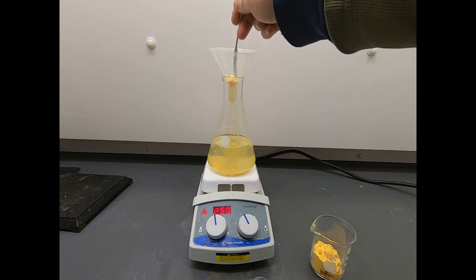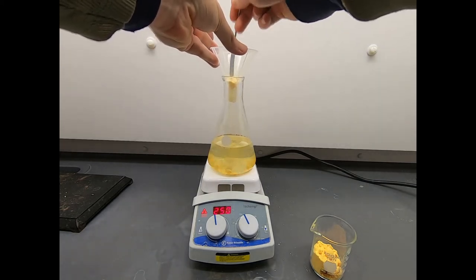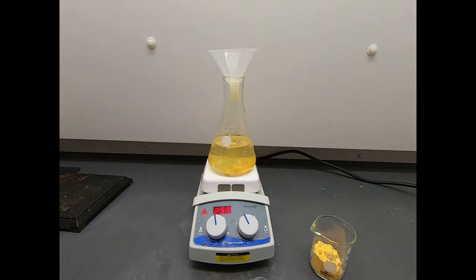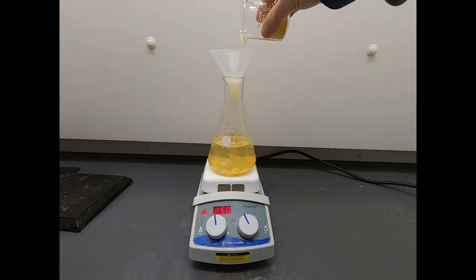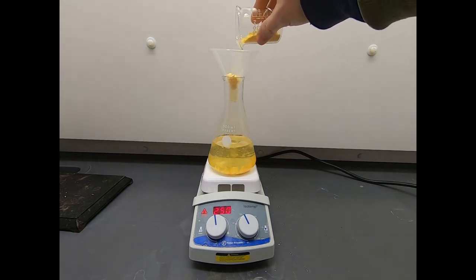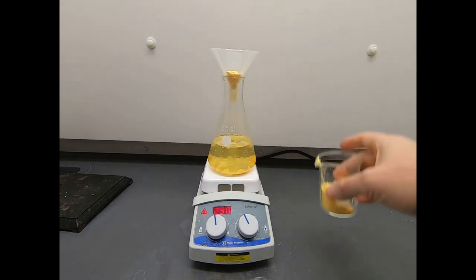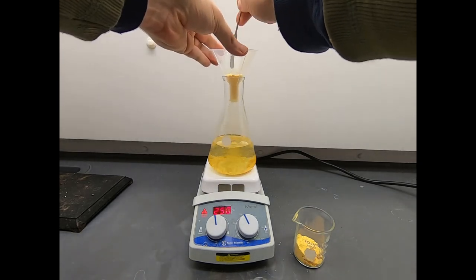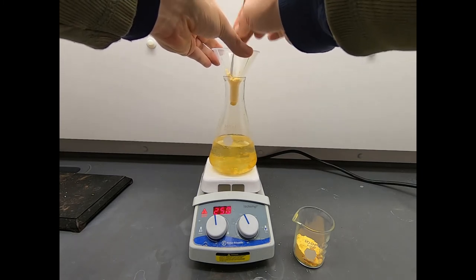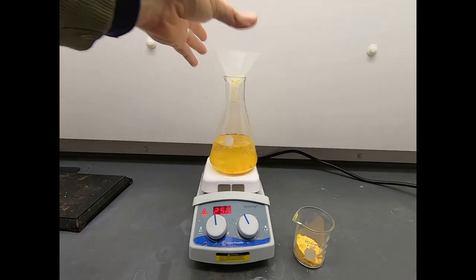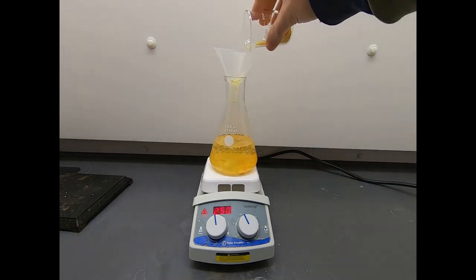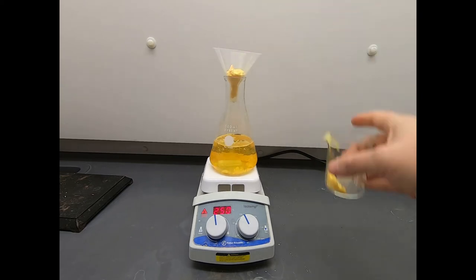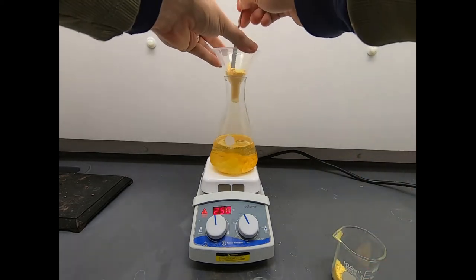We are dissolving the solid, and everything is going in solution. This might take a few minutes.